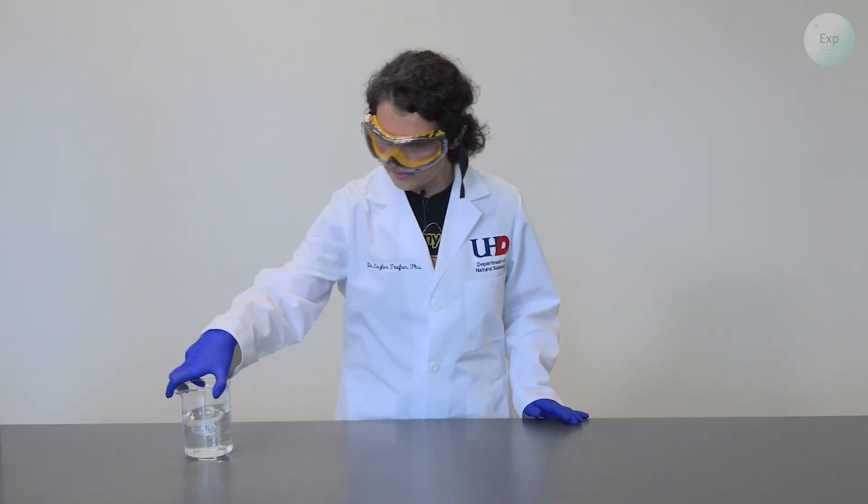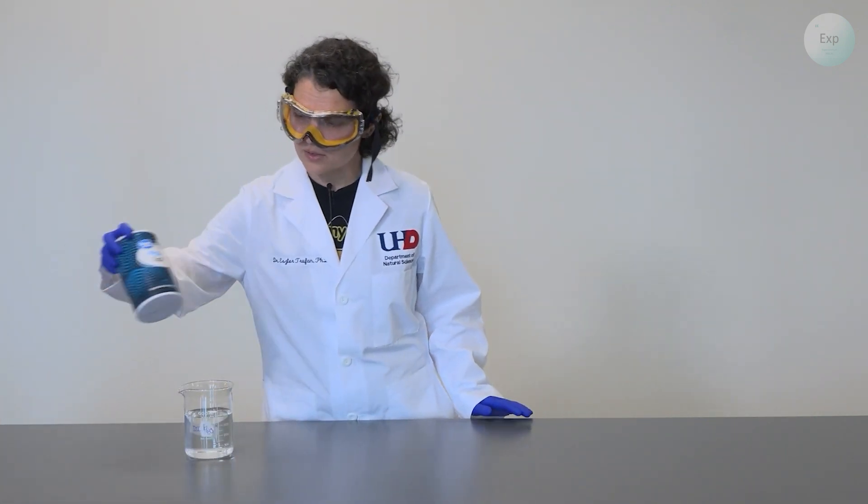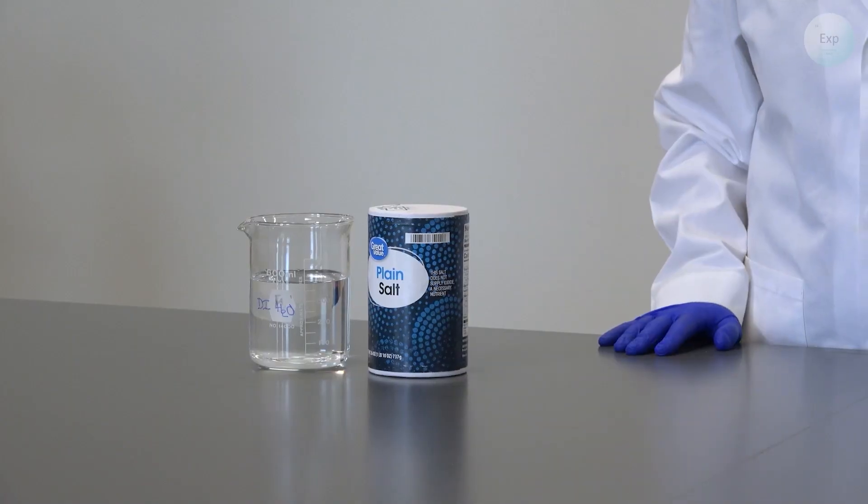For the experiment, we are going to need only two materials: deionized water or distilled water and plain salt or sodium chloride.